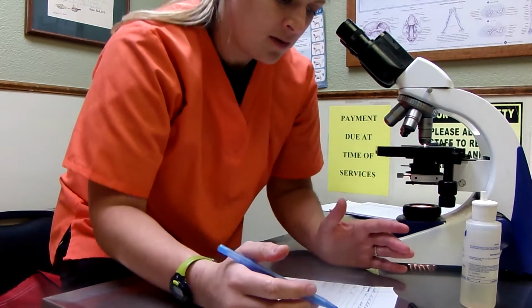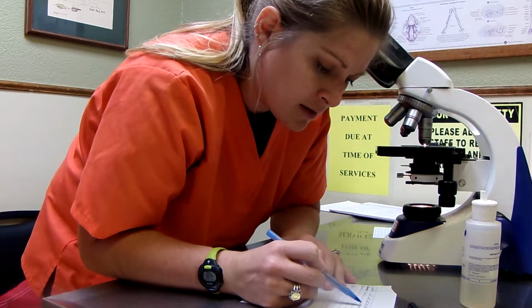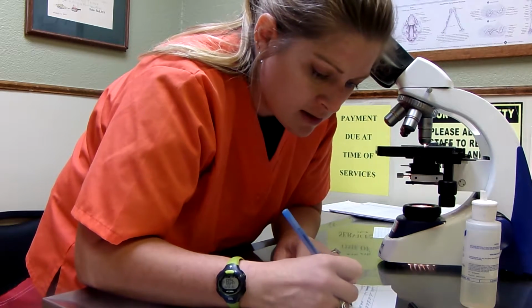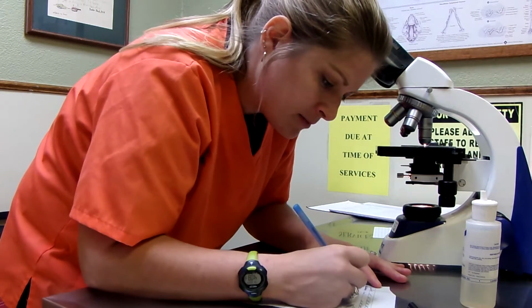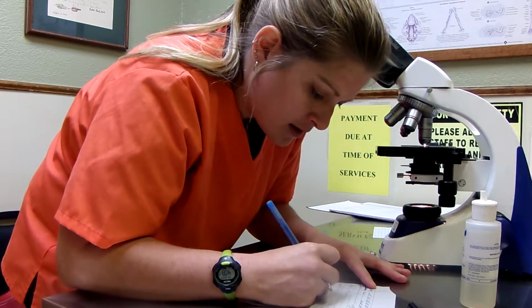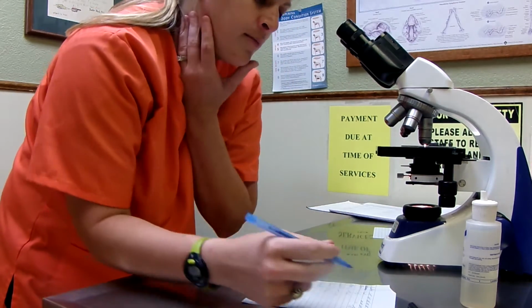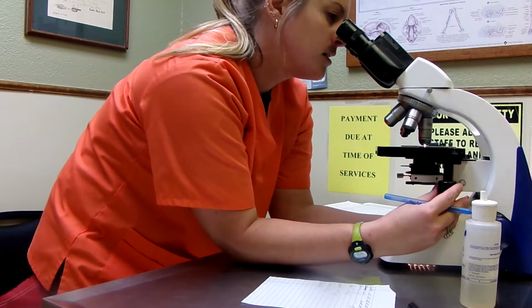Okay, right, so what we're going to go through and do is add these up. 5, 10, 15, 67, or really 68. 8, 9. Okay, and then let me go through real quick and look at our platelets.